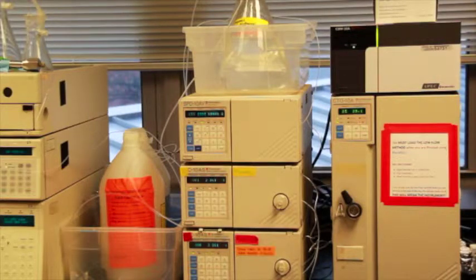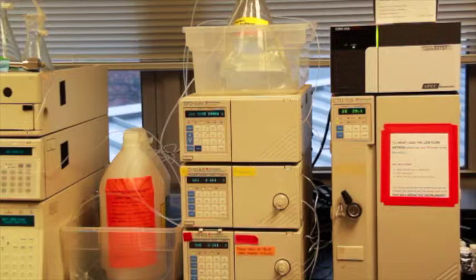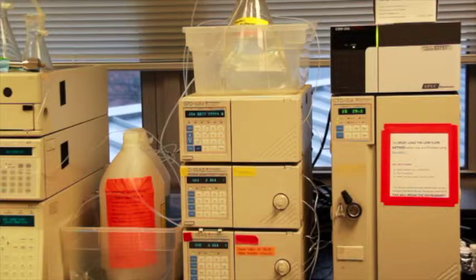If you have less than half a container, so less than 1000 milliliters of solvent in the methanol or the water container, you should degas more. If you have questions about how to do that, please ask a lab assistant or your instructor.